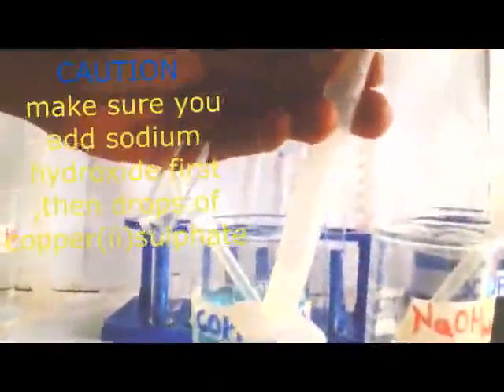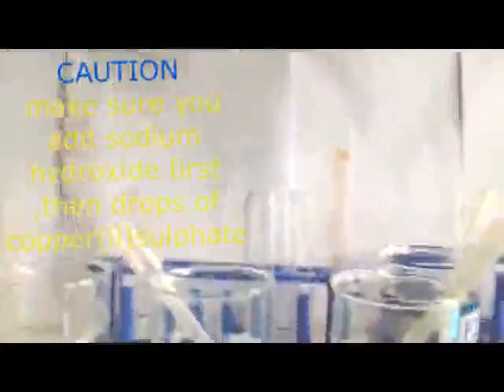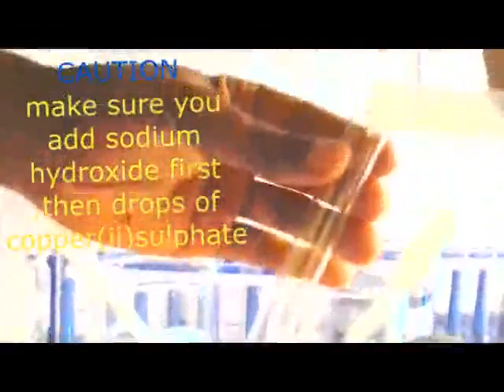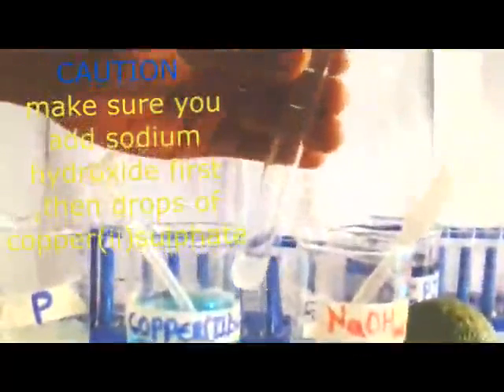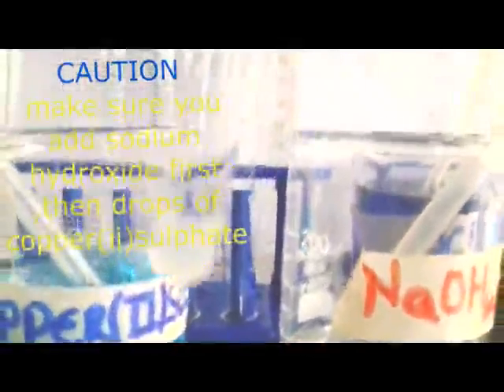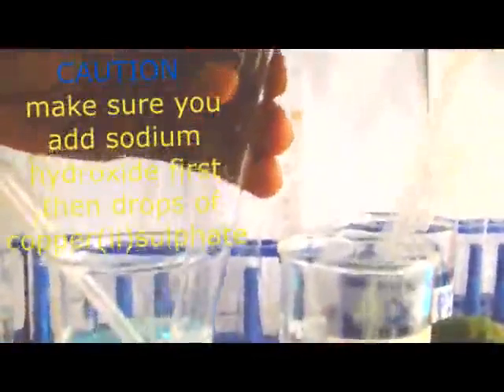Then I'm going to add it in my test tube. After adding it there, remember when you are using the test solution, always use little, don't bring a lot. A lot will give you wrong results.